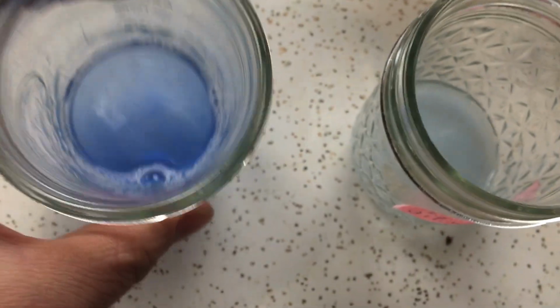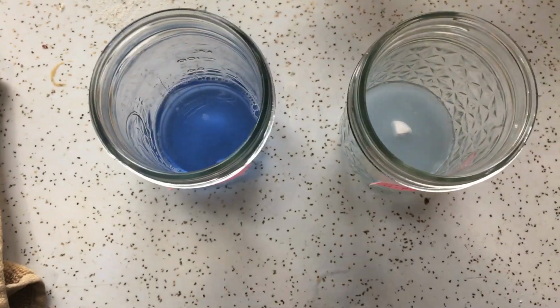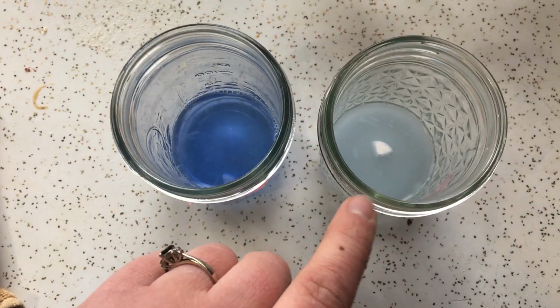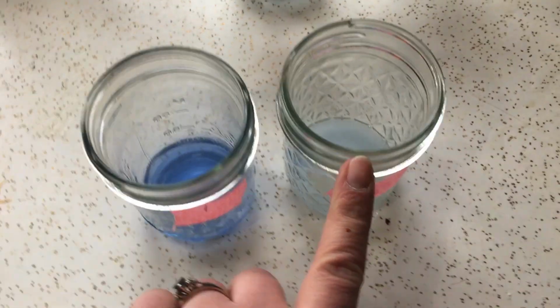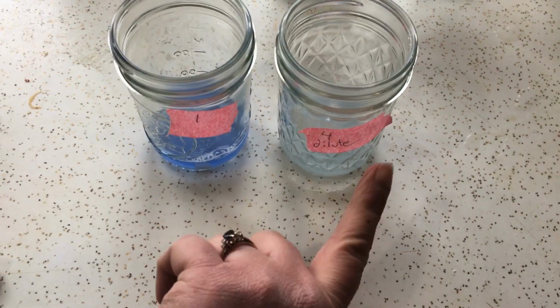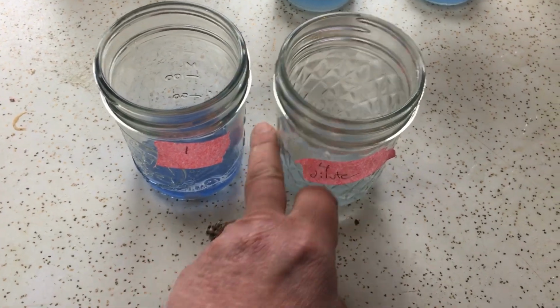like hardly any bubbles. The bubbles are the carbon dioxide. No, that's just from me shaking it. So I would say not much happened, and that is because of the chemical dilution here in test tube number 4, because it was diluted. So if we dilute one of our chemicals, it slows down the rate of reaction.